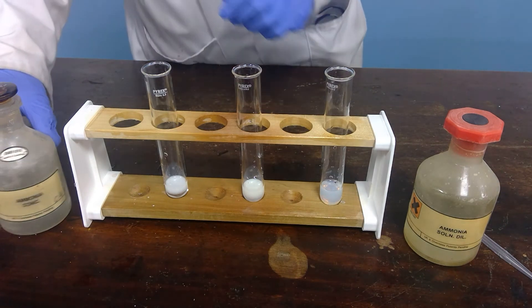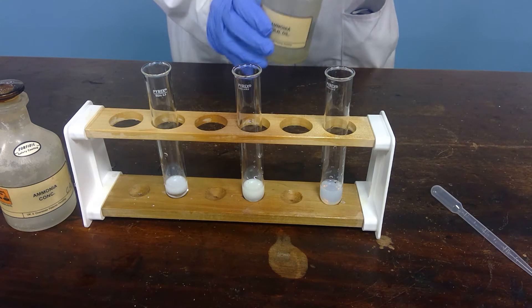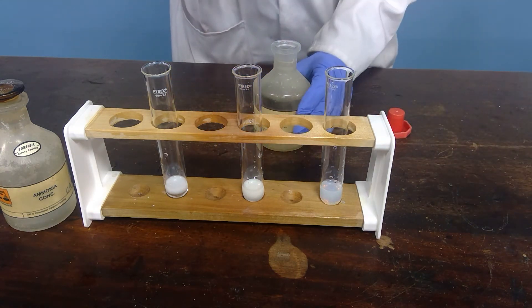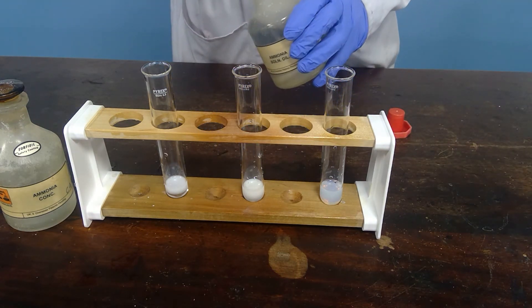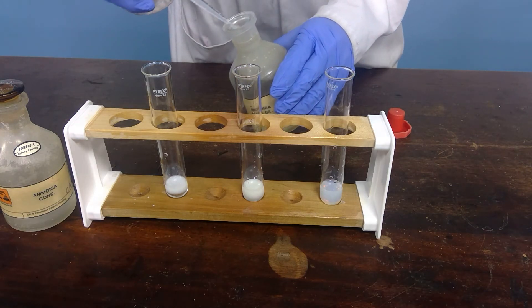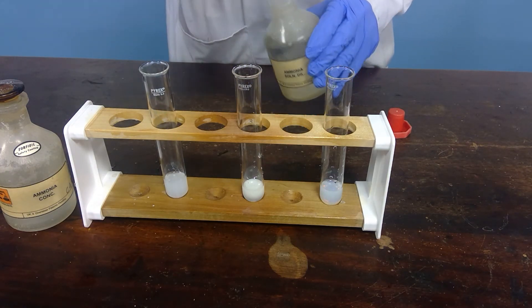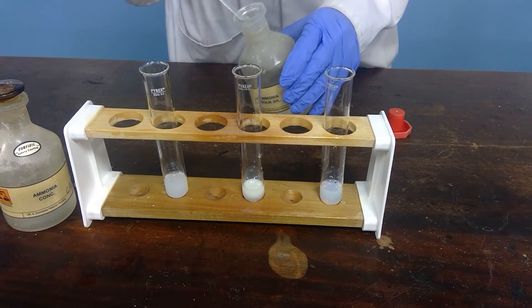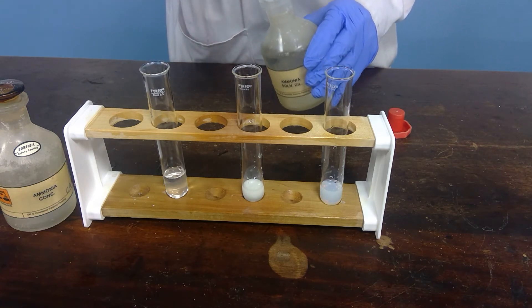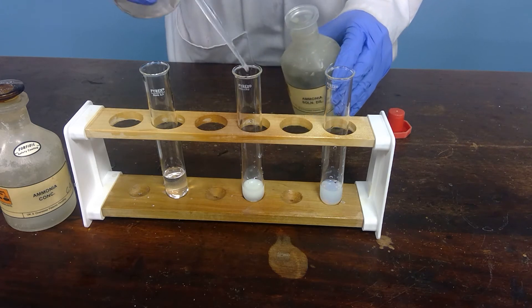Now if we take some dilute ammonia and add dilute ammonia to each of these, we are able to distinguish between the halides to some degree. If I add dilute ammonia, you will see that the chloride dissolves to give a colourless solution.